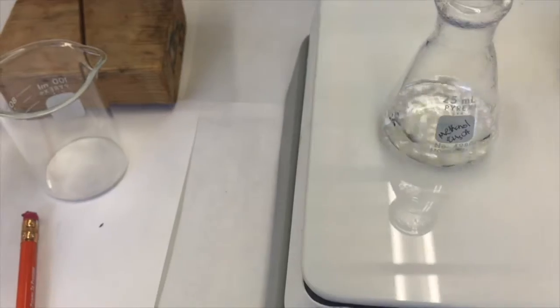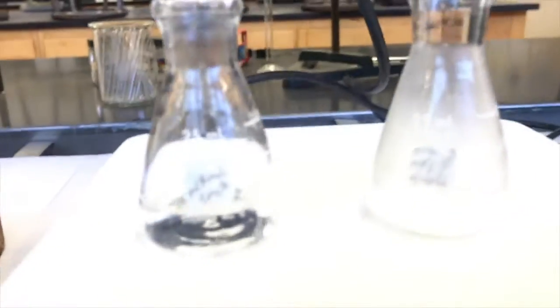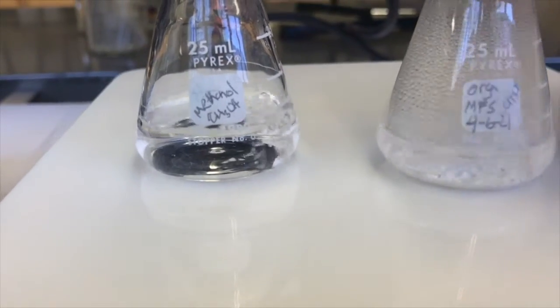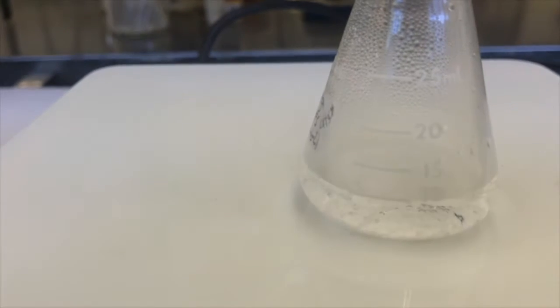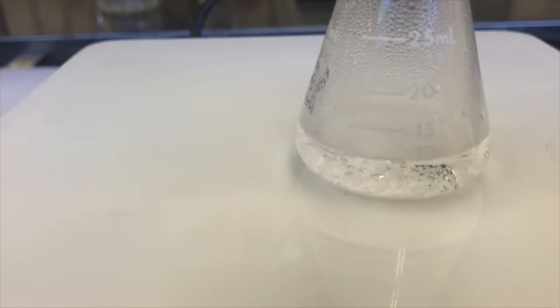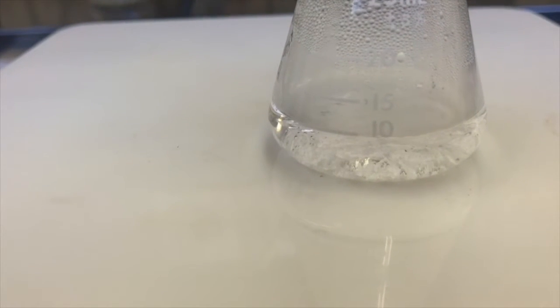My crystallization methanol solvent's running out a little bit. And I don't want to add too much of it yet to the crystallization flask because it's not boiling yet. It's still warming up because it was cooling. Maybe I'll lift this off for a little bit. Wow, so I don't want to just evaporate it all away. Waiting for this solvent to start going. There it is. Bubble off. The solid that we're crystallizing is acting as boiling stones now, huh?